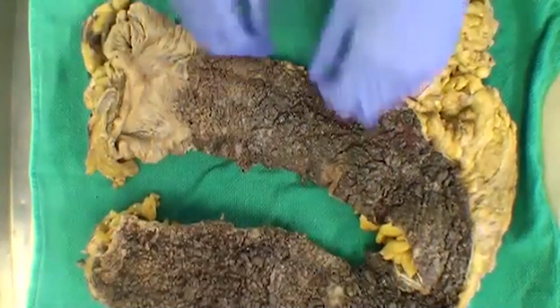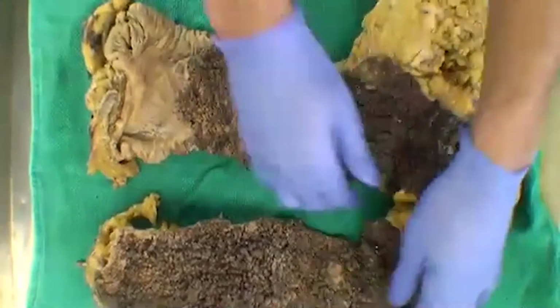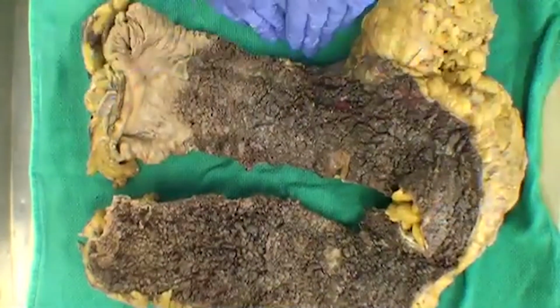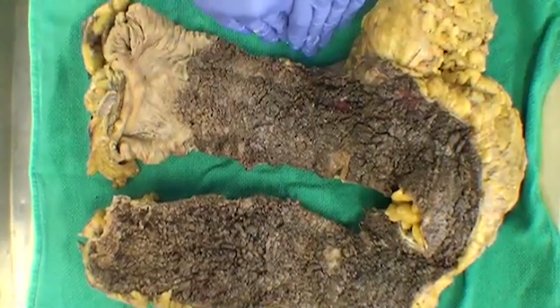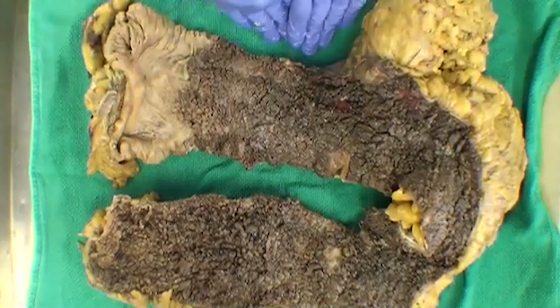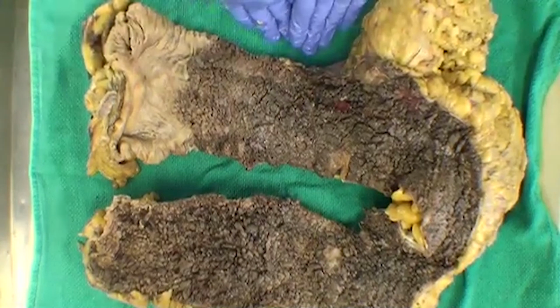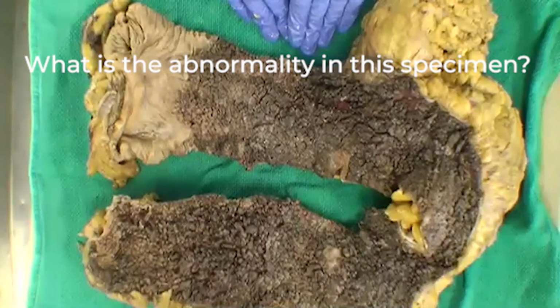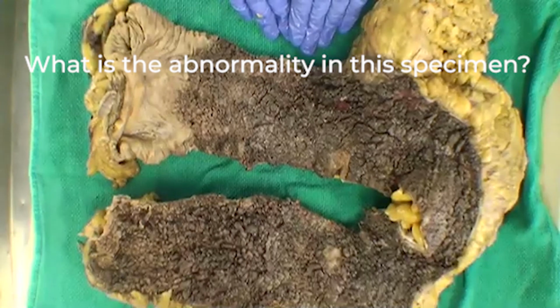It might be a subtotal colectomy, but typically a hemicolectomy would probably end somewhere around here. So it's a bit more than that. Yeah, we have two more subtotal colectomies. So that's probably the most correct in terms of the specimen type. And now there's obviously something going on with this specimen. Does anyone want to comment on what they think is the abnormality?